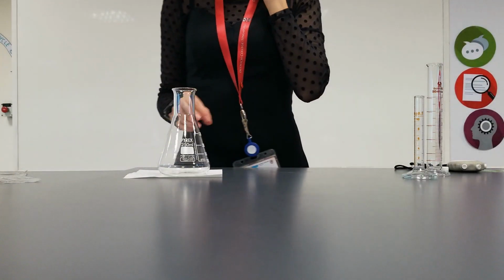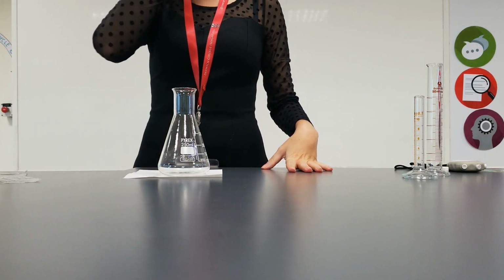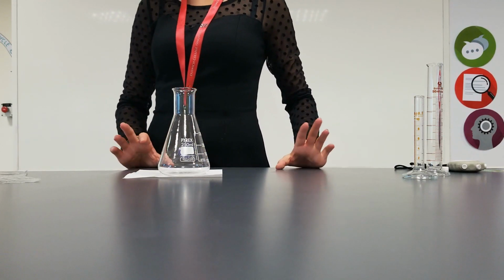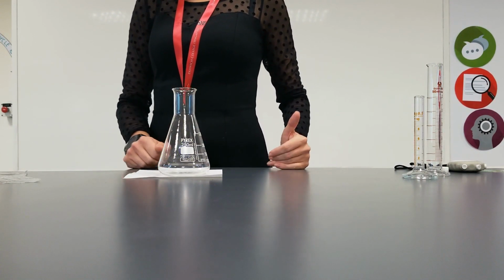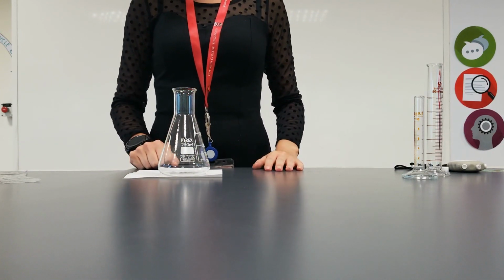Okay guys, so I'm only going to demo 3 of the 6 that are on your sheets, because there's no point in wasting your time watching all of them. So I'll demo the 0.2, the highest concentration, the 0.14, so the fourth one down, and the 0.1, so that you have an idea of the time differences between them.